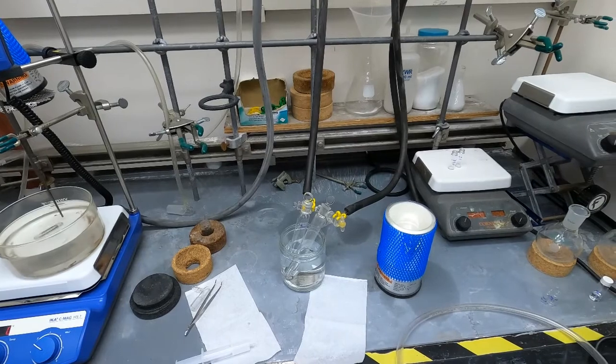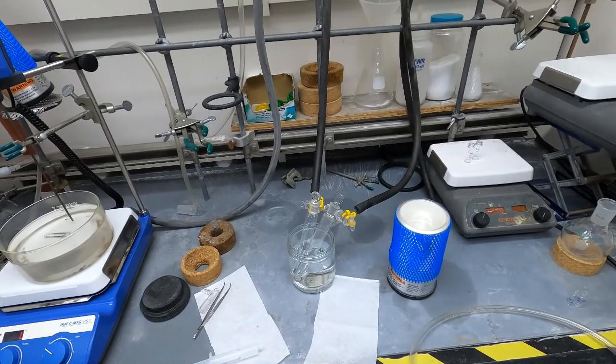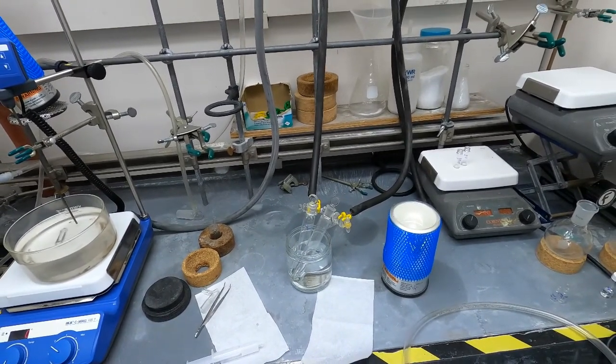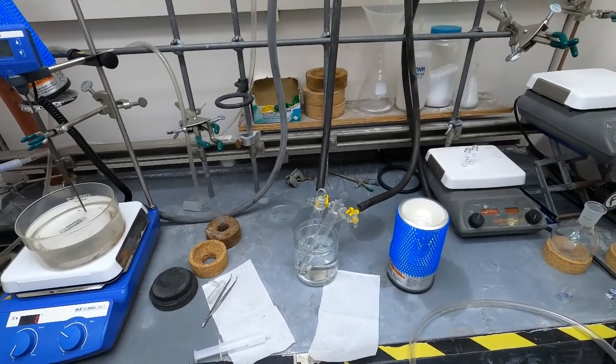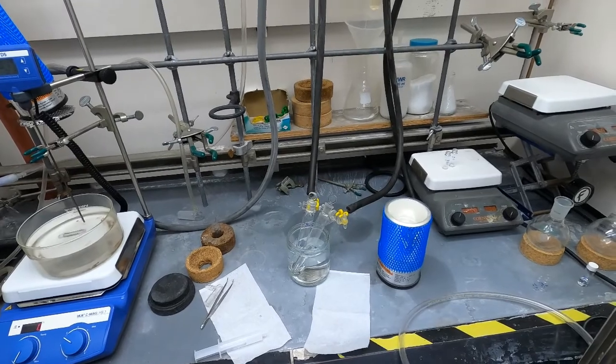Today I'm going to show you how to do freeze pump thawing. This is a technique for degassing solvents or in this case I'm degassing my reaction mixture.